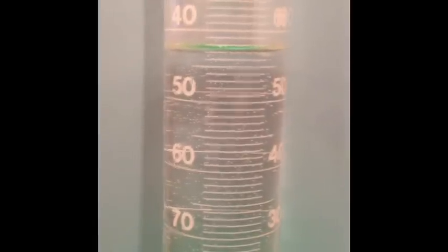Now, let's go back over to our other graduated cylinder and go ahead and zoom into that liquid. This graduated cylinder can be a little tricky because you'll notice you have a 60 here, but a 40 over here, and then you have a 50 and a 50, and then it goes from 40 and a 60.